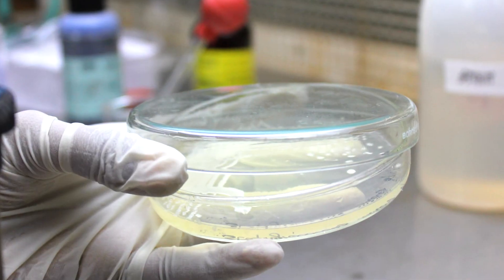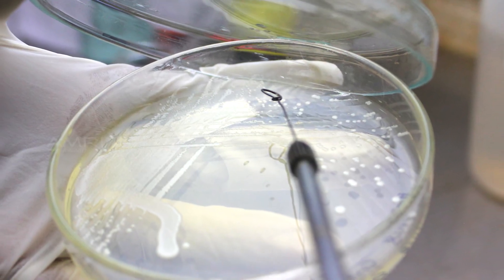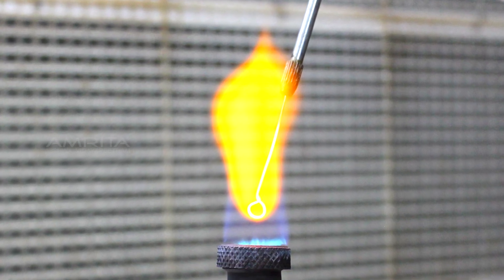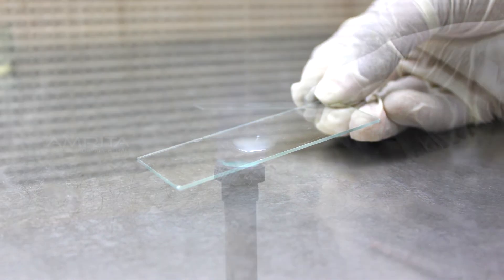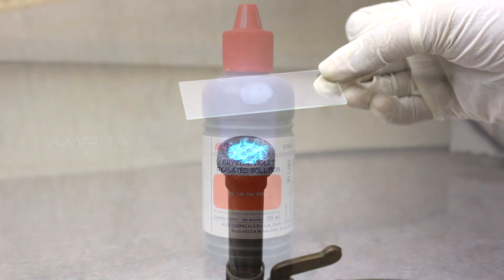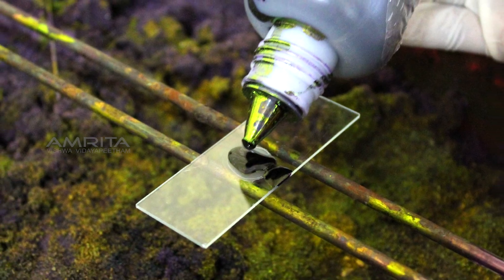Now open the culture plate and pick one isolated colony from the sample. Spread it in an oval shape over the saline water on the slide using the loop. After use, sterilize the loop by heating it over the burner. Now take the slide and wave it over the flame to fix the organism on the slide. Add 4 or 5 drops of crystal violet over the slide and keep it for 1 minute to stain the organism.